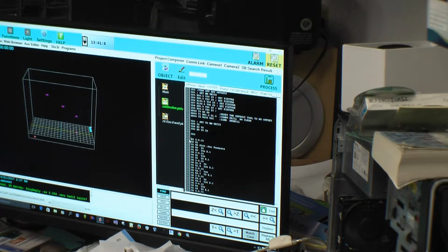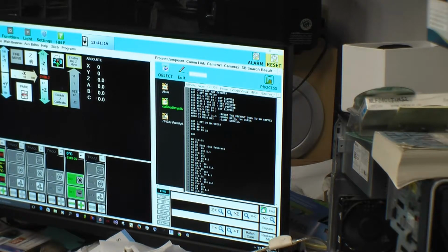Good. Alright, so that's going to give us 150 microns off the layer height right now. And my 54 was 96.2. Oops, wrong one. Not my 54, my height, H1, is 96.2.